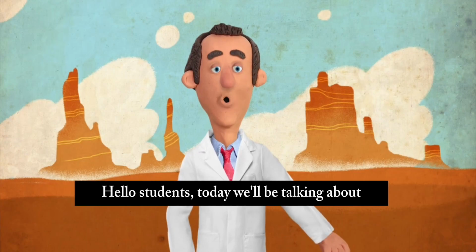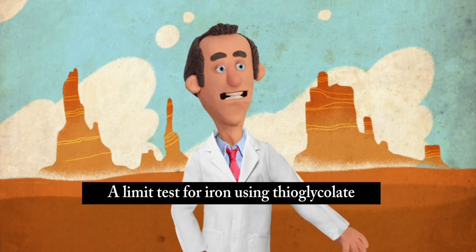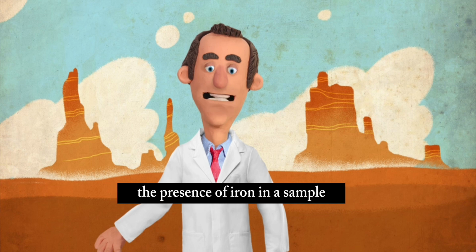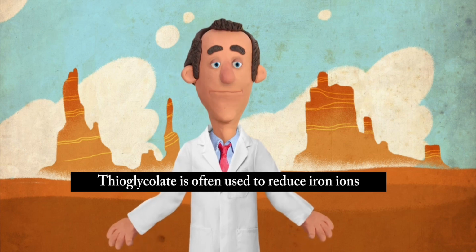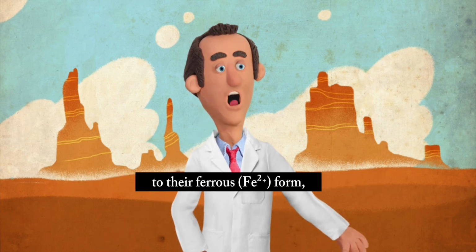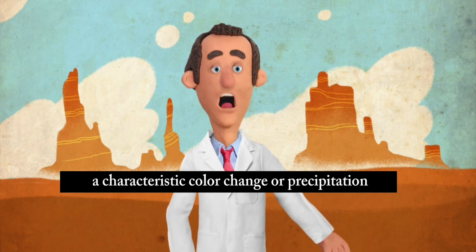Hello students, today we'll be talking about the limit test for iron using thioglycolate, a specific method for detecting the presence of iron in a sample. Thioglycolate is often used to reduce iron ions to their ferrous Fe2+ form, which can then react with other reagents to produce a characteristic color change or precipitation.